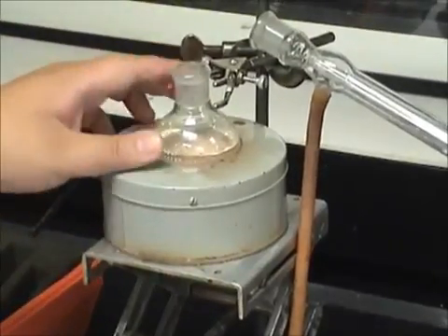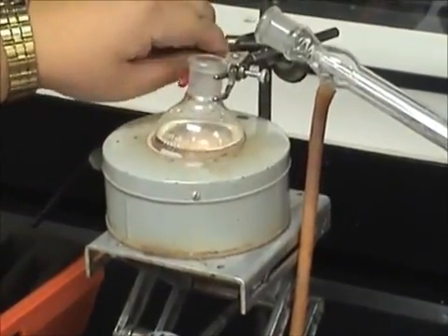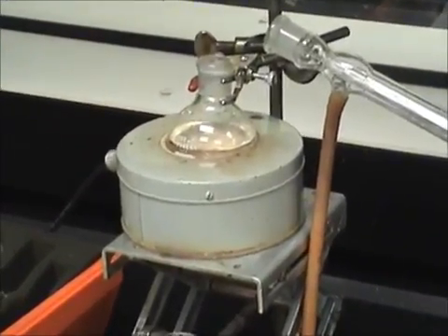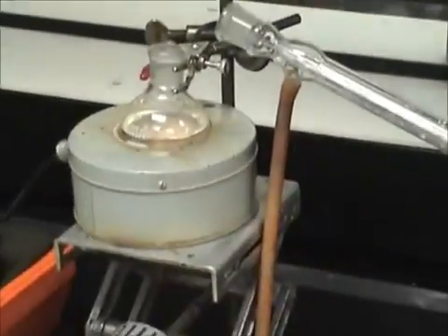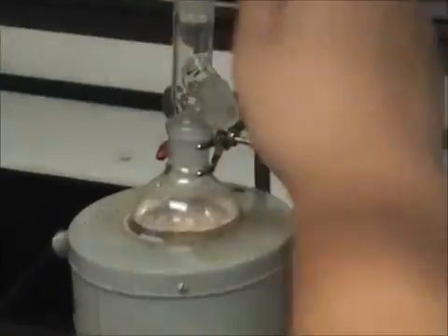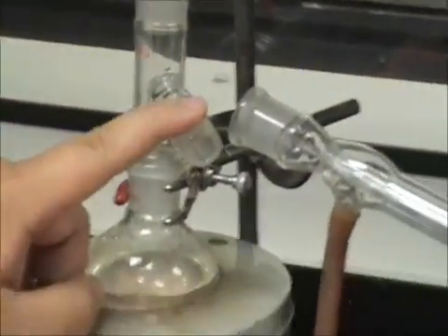Use a clamp to secure the distilling flask. Now let's add the T-shaped distilling head into the distilling flask and the condenser tube. Place the clip to secure the joint between the T-shaped head and the condenser.